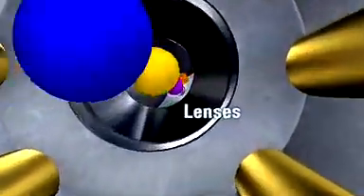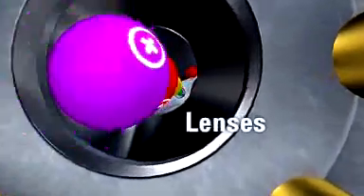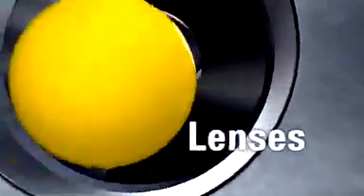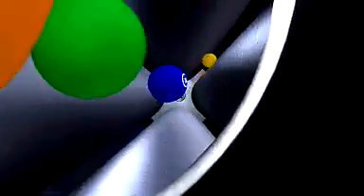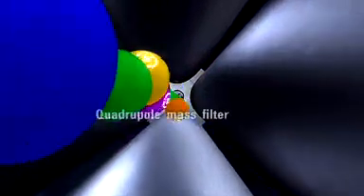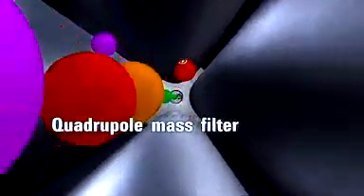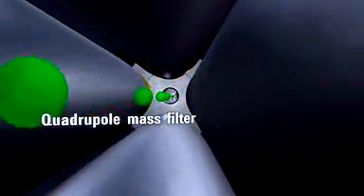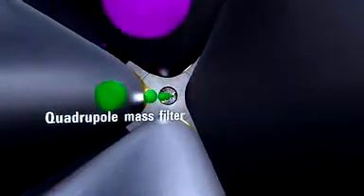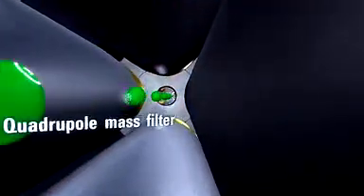Patented lenses enhance high-mass ion transmission and increase sensitivity over a wider mass range. The first quadrupole mass filter allows only ions of the target mass to pass through.